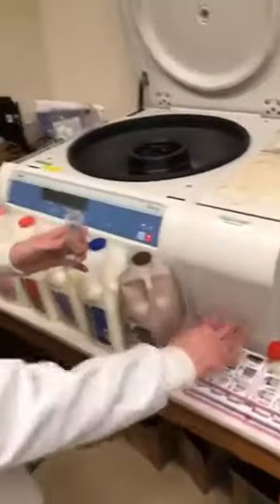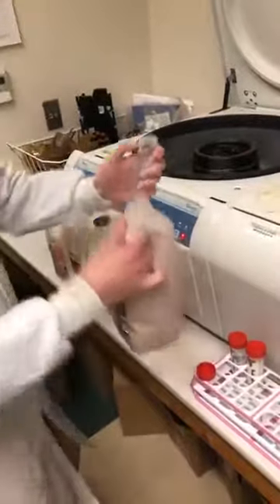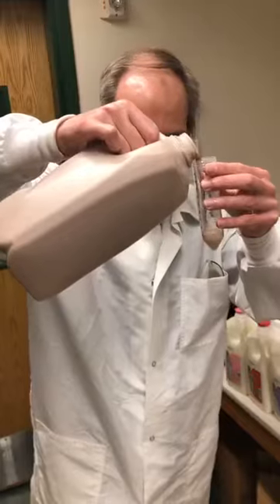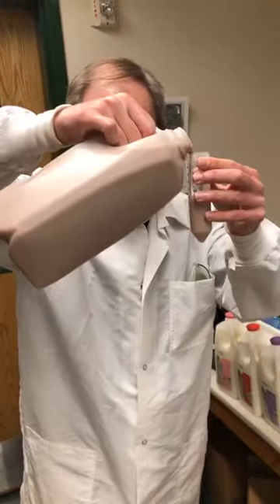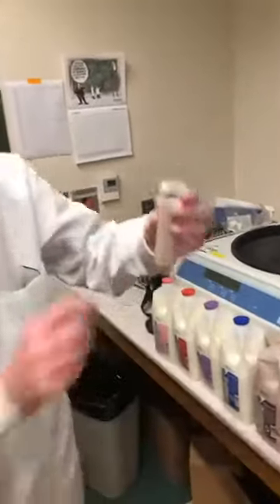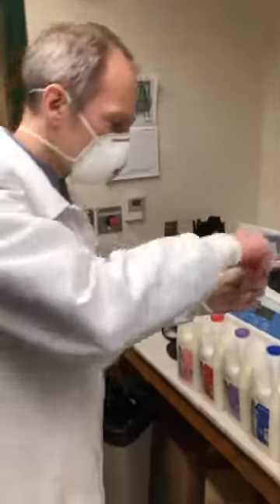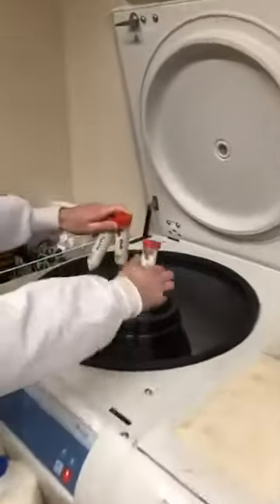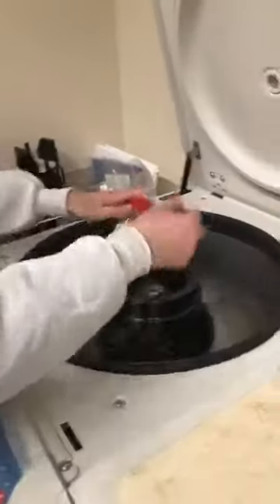So let's prepare one of the tubes — I already prepared a few others. Let's get some of the chocolate milk in this tube. I labeled the tube 'chocolate' so we know which is which, even though it's kind of obvious. I'll pour some of the chocolate milk in here. I've brought this up to 40 milliliters. Now let's load the instrument. To confirm: at the beginning, low fat, whole milk, fat-free — they all pretty much look the same, right? We can't really tell the difference.